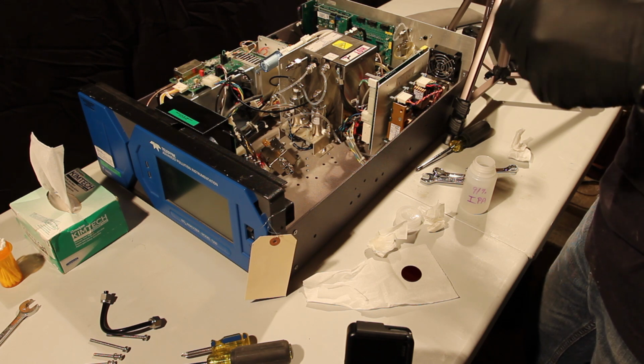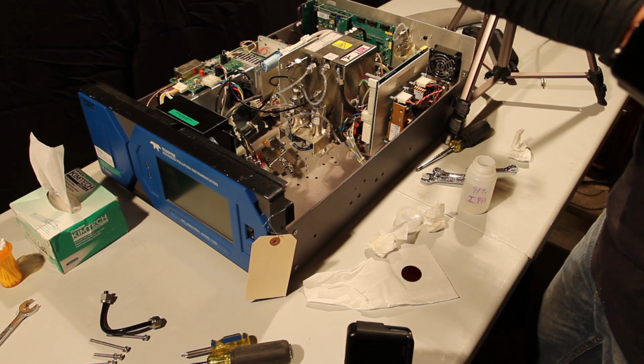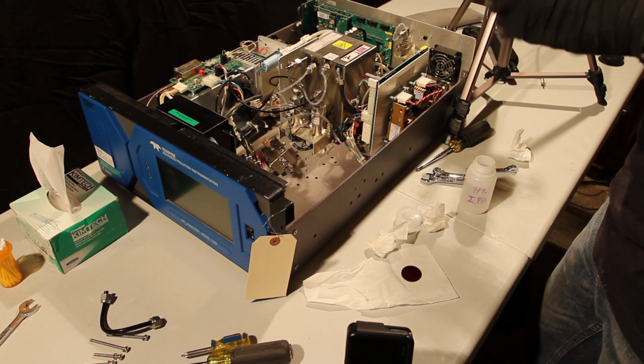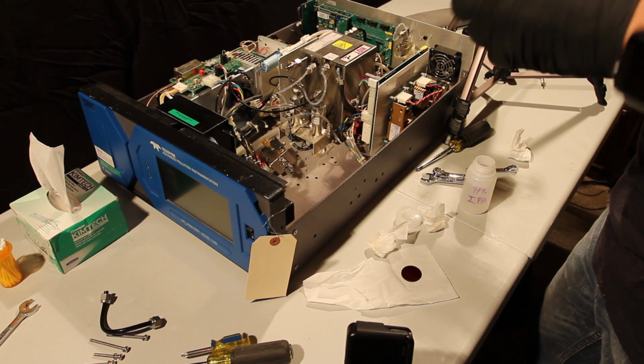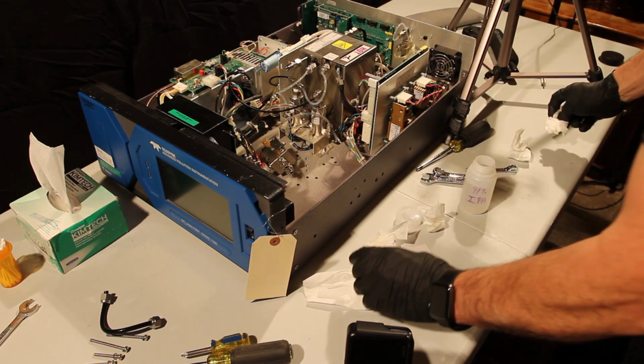And you can change these O-rings. Typically they'll last a few cleanings. It's not bad to have some on hand. If you get this apart and find a bad one, then I'd want to have all these O-rings to put back together. I don't happen to have them right now, so I'm going to put it together without doing that.